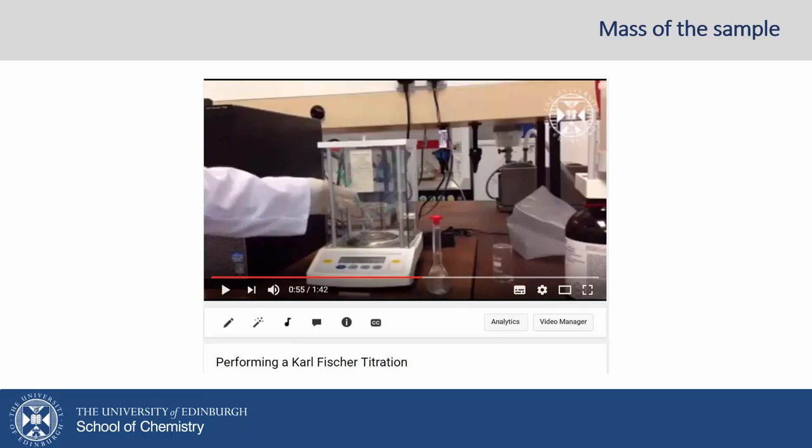In this experiment, you will use both methods. The pre-lab techniques video talks through the steps to be taken. It's a very easy procedure, but at its core is the knowledge of the mass of the sample. You'll need to take care in determining this.